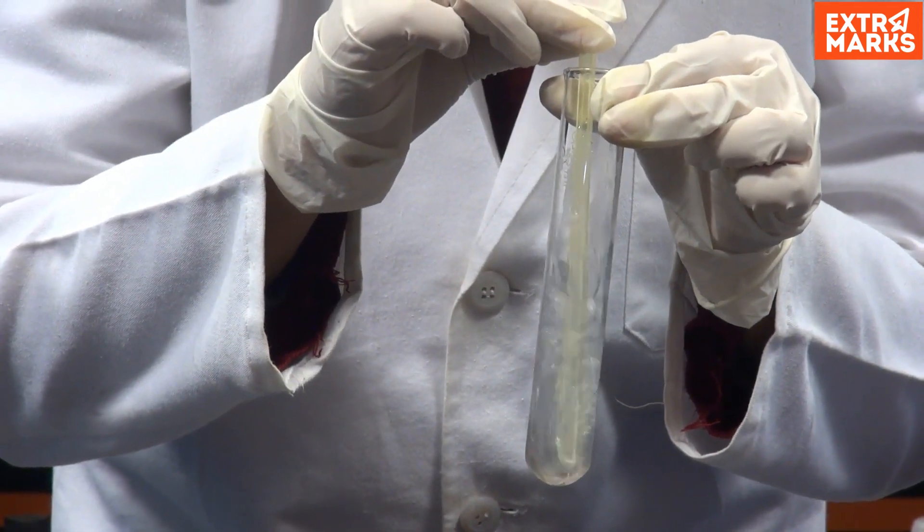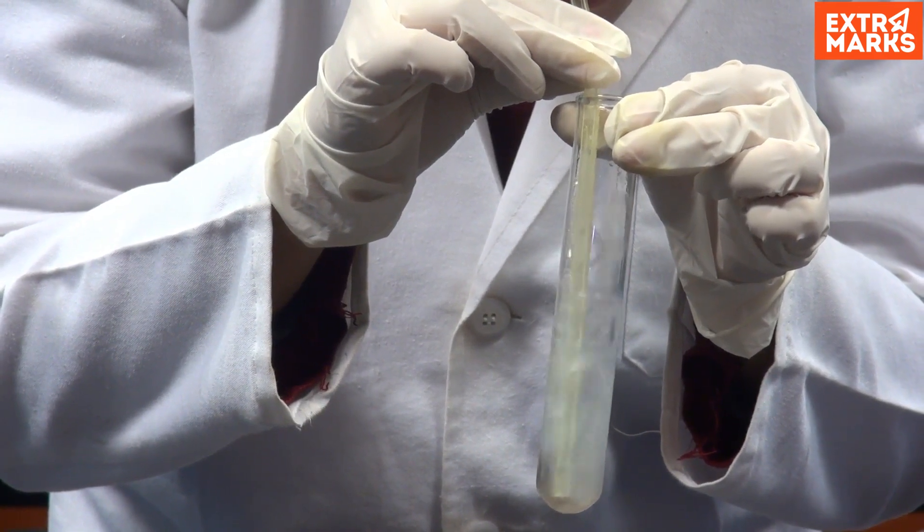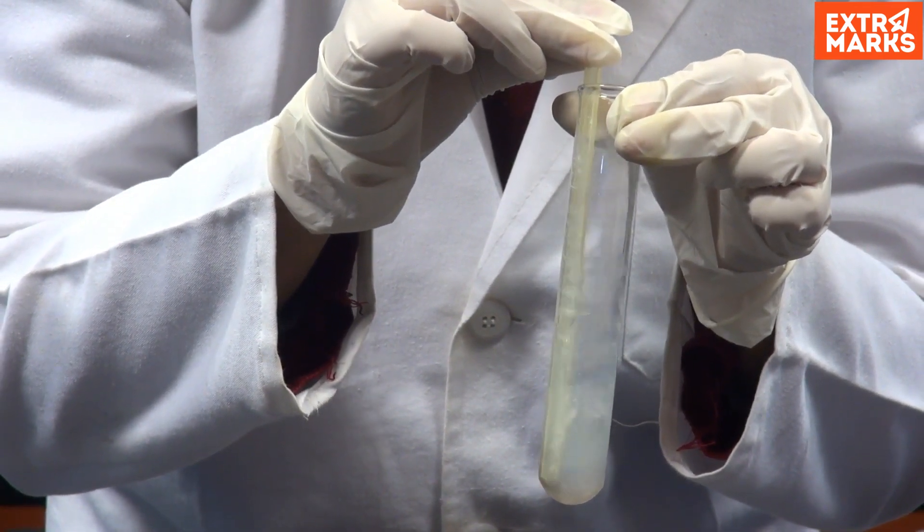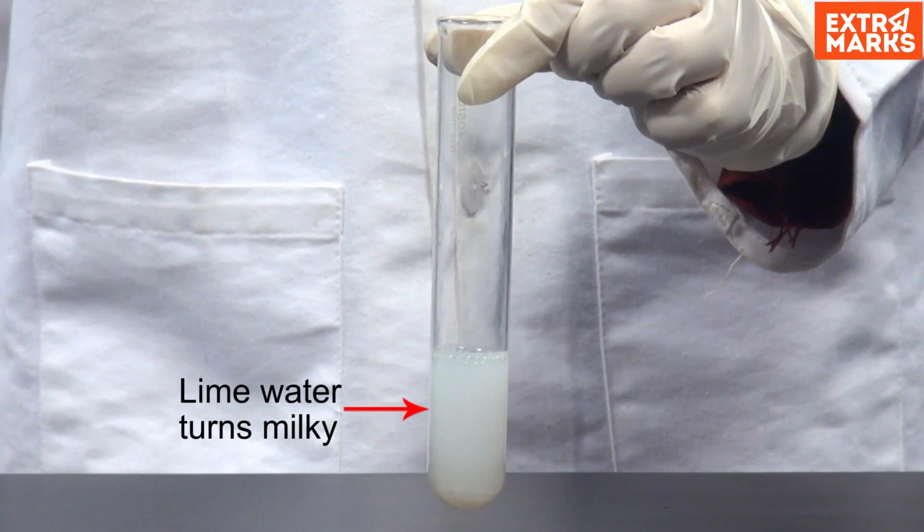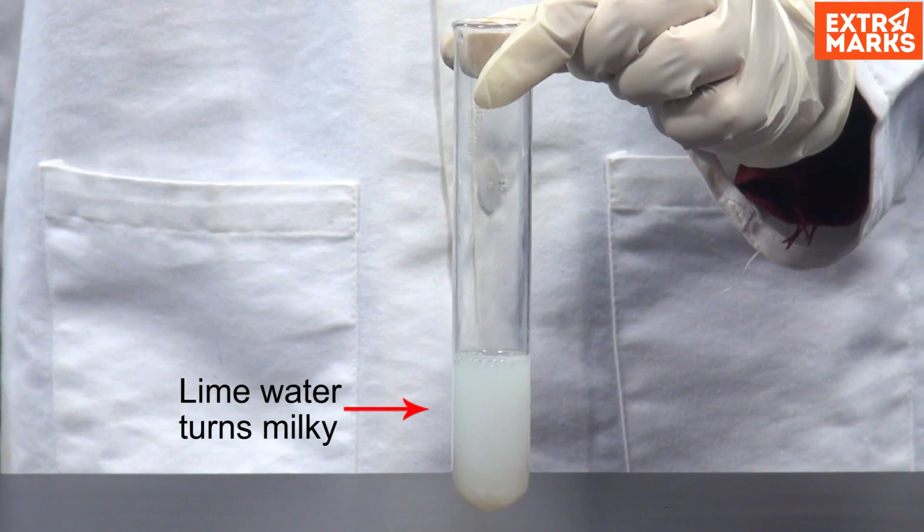Blow the exhaled air into the test tube containing lime water and observe. Notice, the lime water turns milky due to the presence of carbon dioxide gas in the exhaled air.